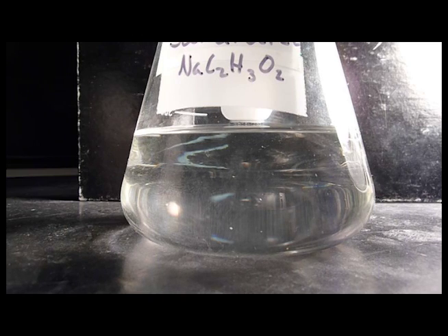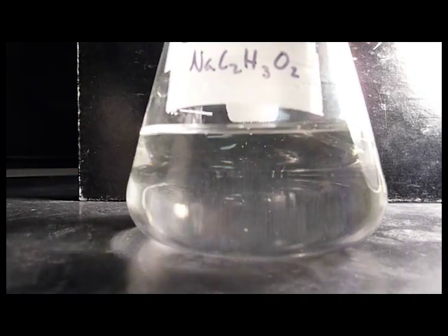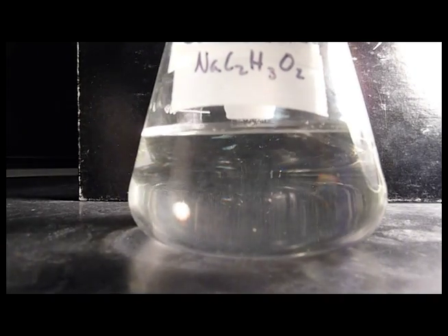It basically means I took some sodium acetate and dissolved it in water until no more would dissolve, and I increased the temperature, dissolved a little bit more, I let it cool off very slowly, so you can see it's still a liquid. It's at room temperature right now.